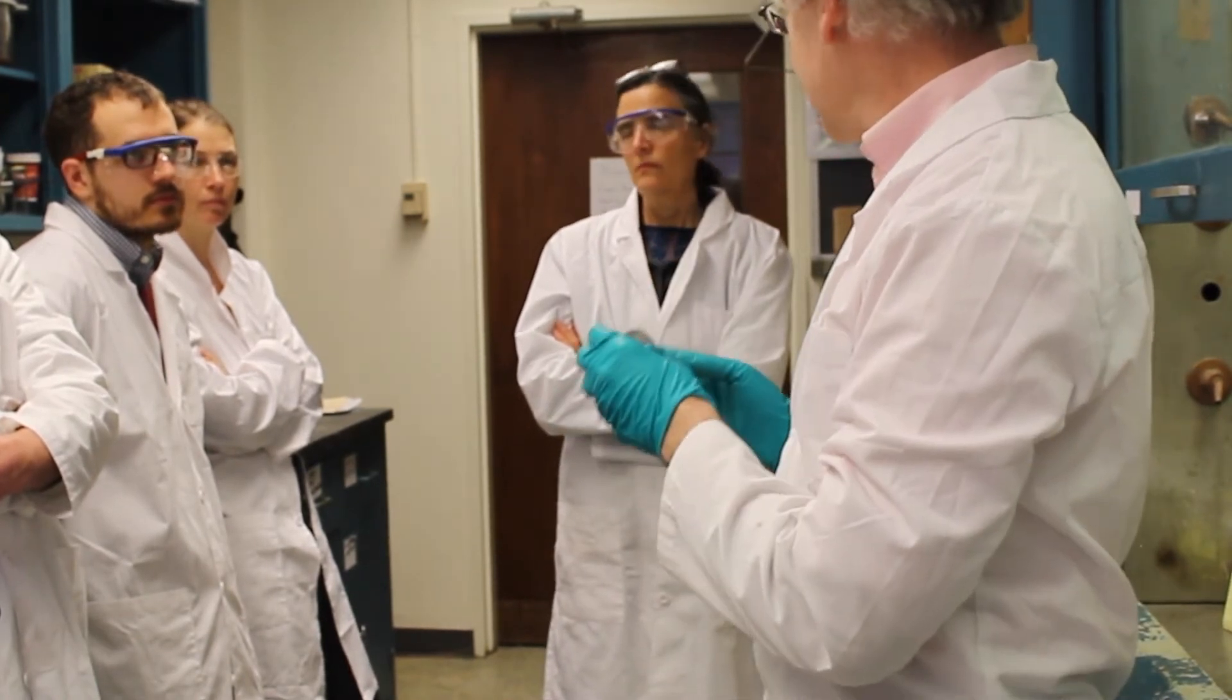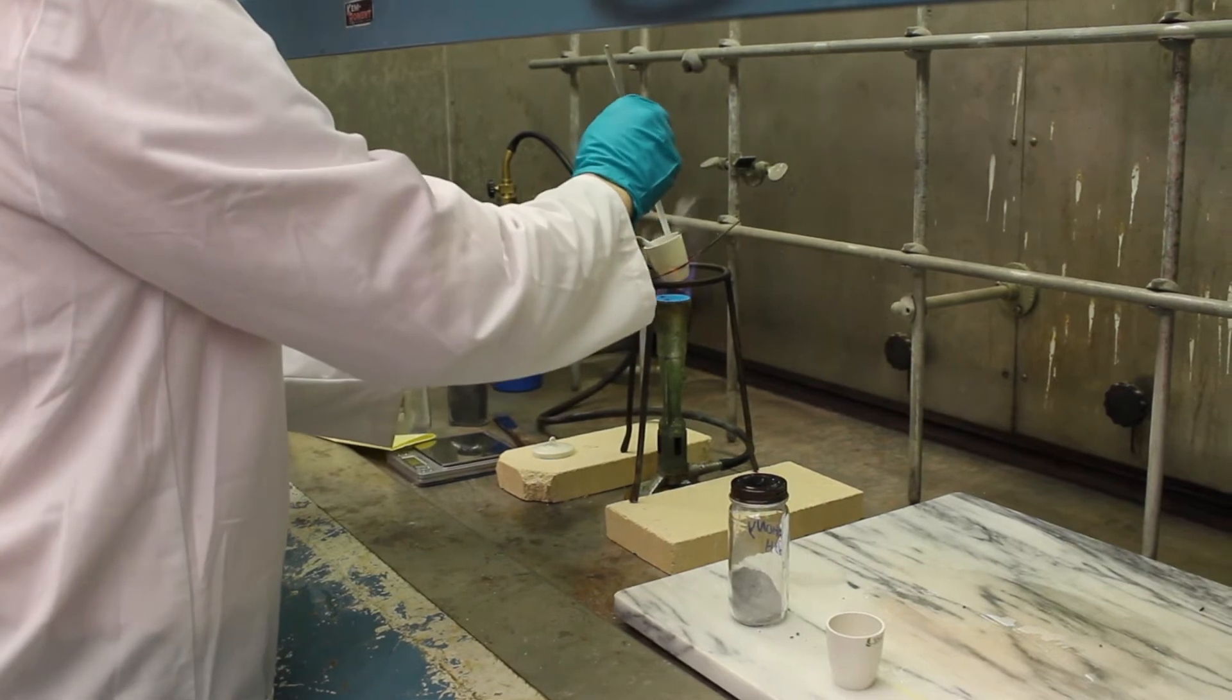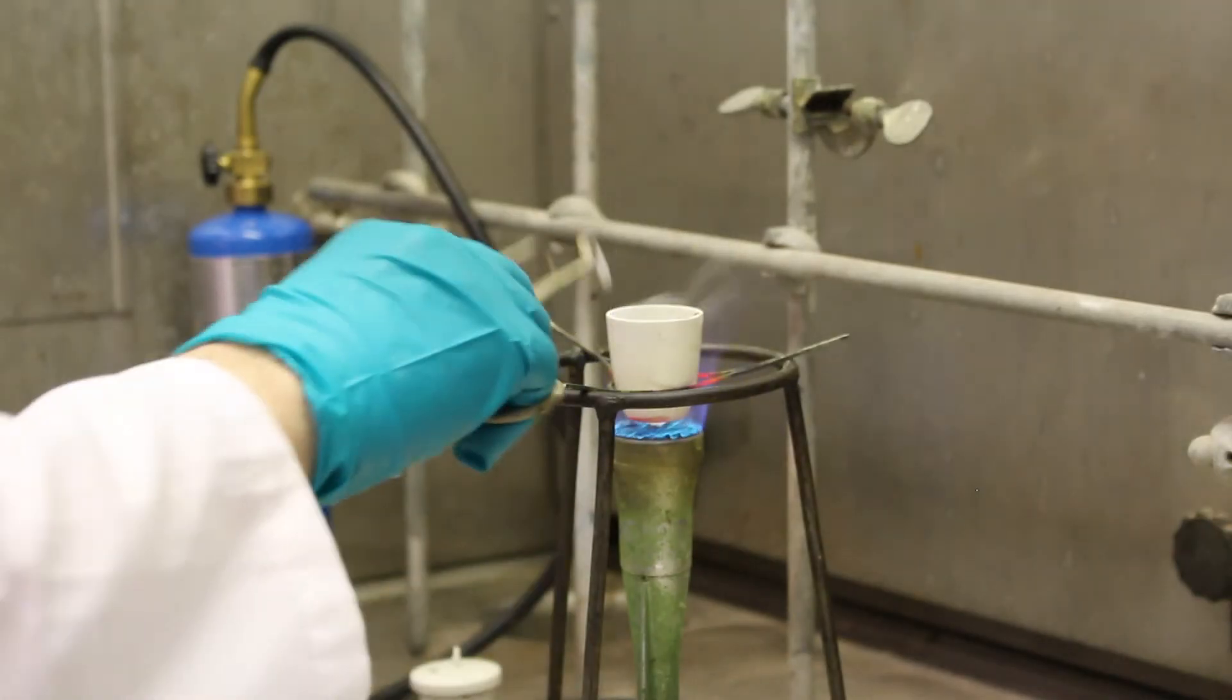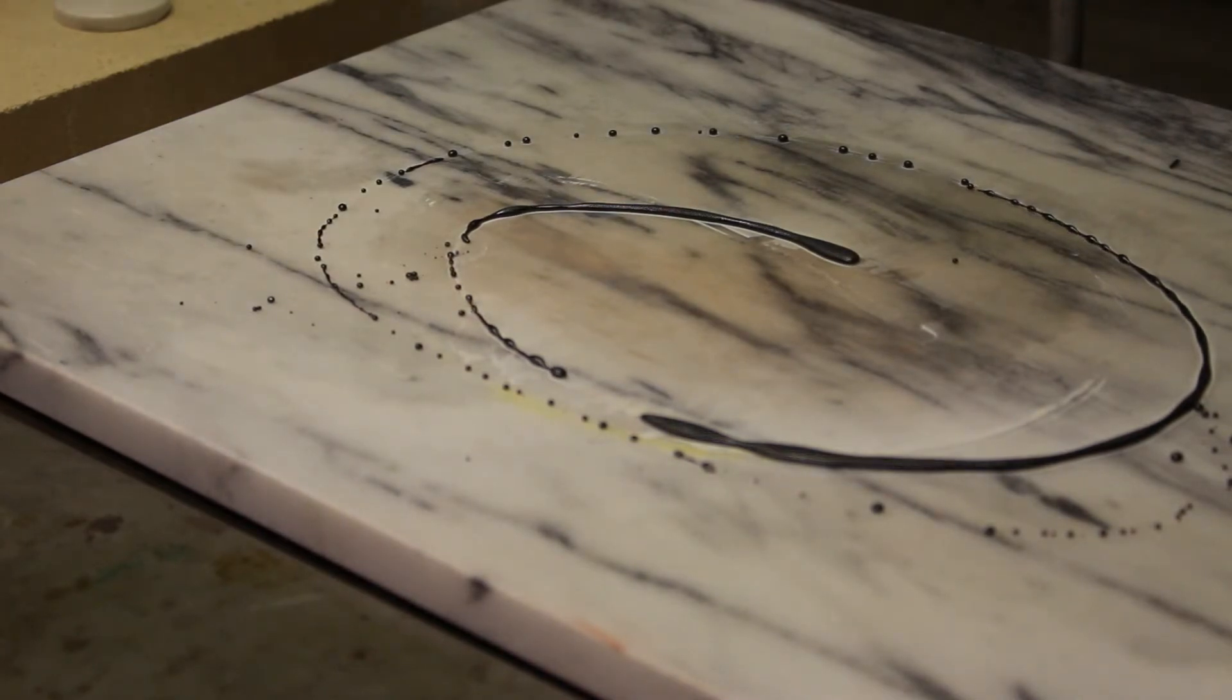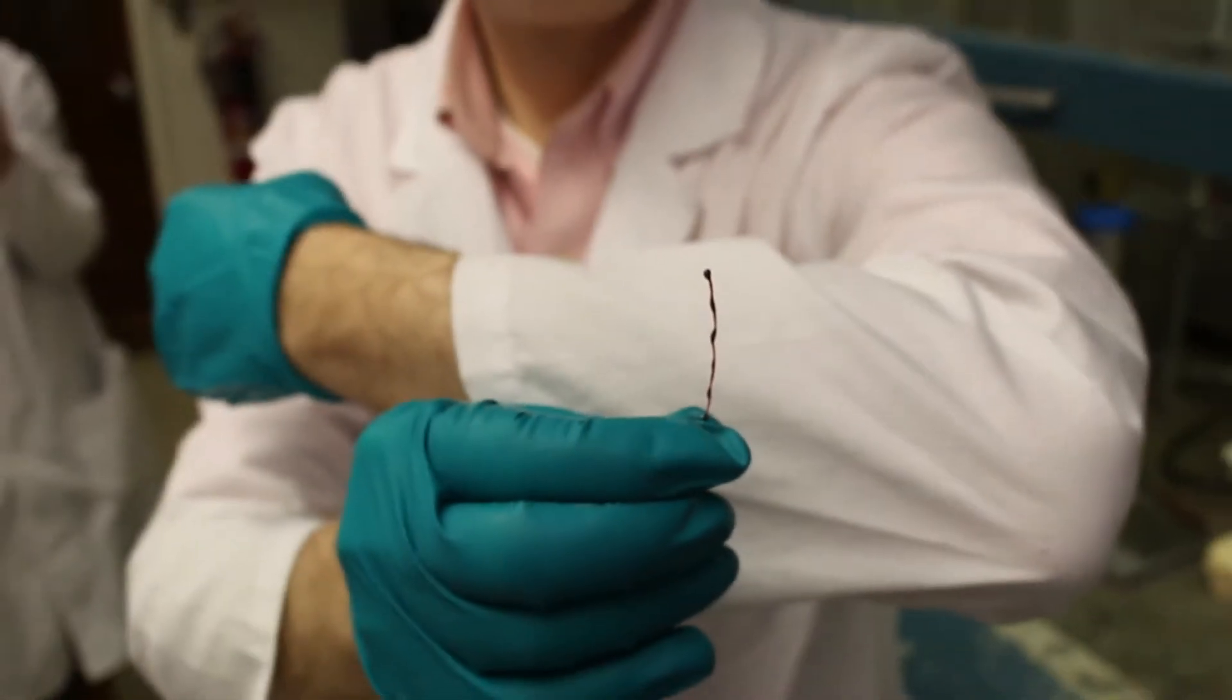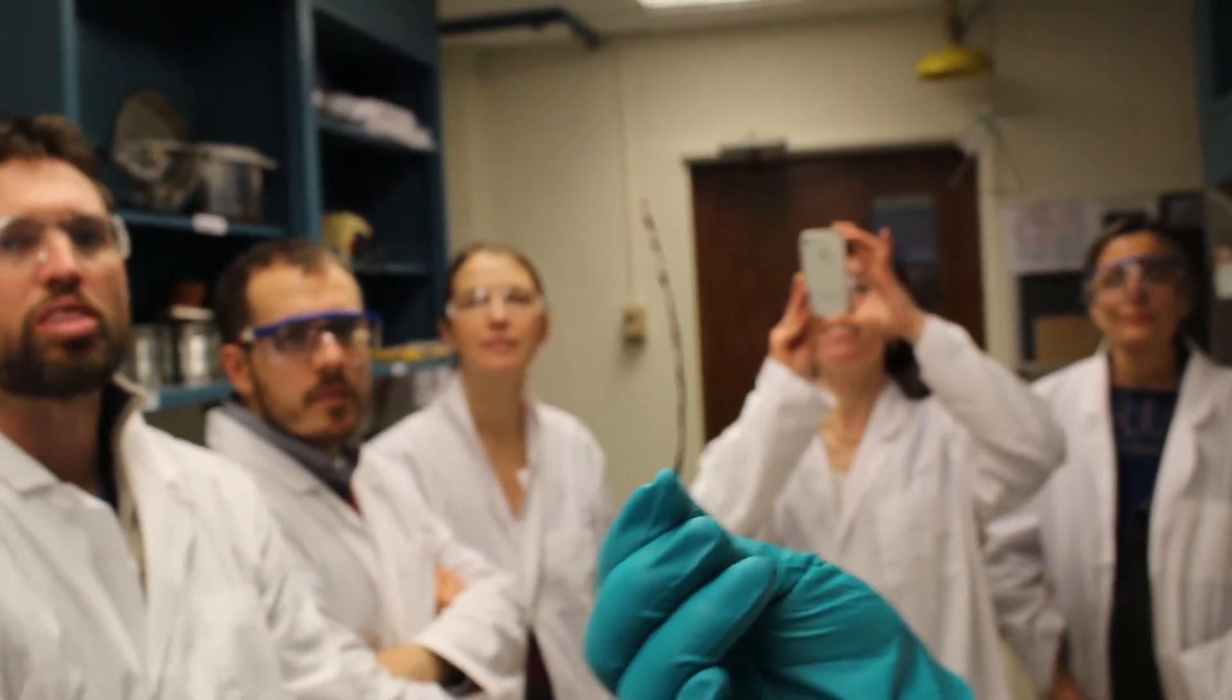Now the question is, if I do it exactly following Valentine's recipe, will I get the yellow glass? Let's give this a try, see if it's a little bit better. It's still crystallizing in parts. Ah, but we have a nice thin bit over there that will show the color nicely. Ah, here, look at this. And you can see that it's not just black, it's just a varnish. And this back here looks like, ah, that came out nicely. There. So if you look, I'll leave this all with you and take it out in the sunlight and look at it.